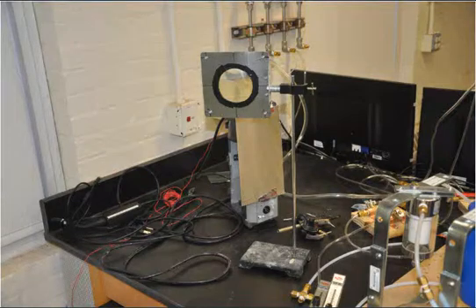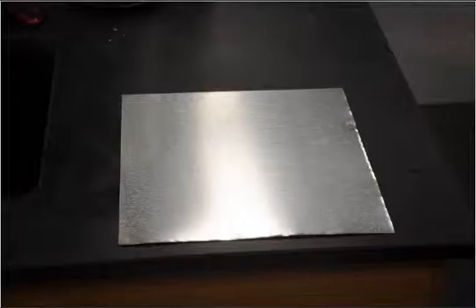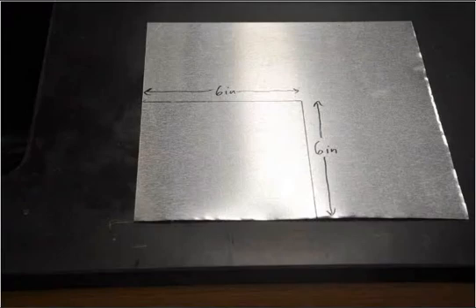that we're using now. The lenses that we're dealing with right now are 100 millimeter diameter, 200 millimeter focal length biconvex lenses. So we start with a standard steel plate. This is, I think, 26 gauge steel. It's quite thin, easily cuttable with tin snips.